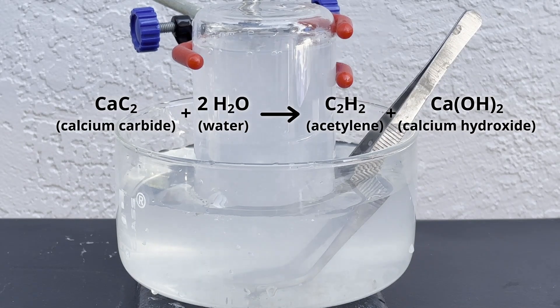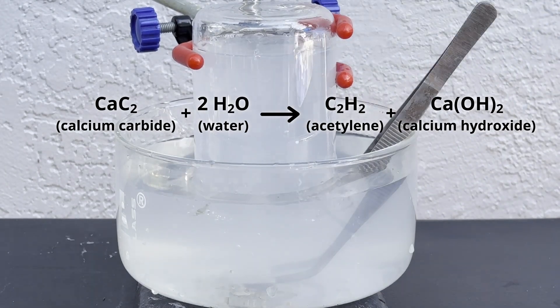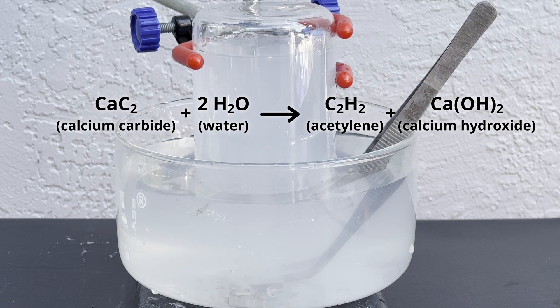You can see the water starting to get cloudy, as this reaction also produces the white solid calcium hydroxide, which isn't very soluble.